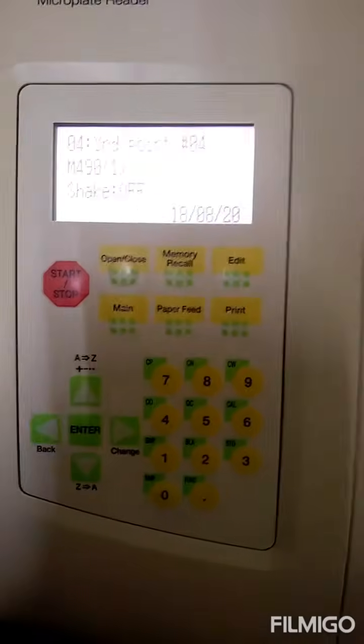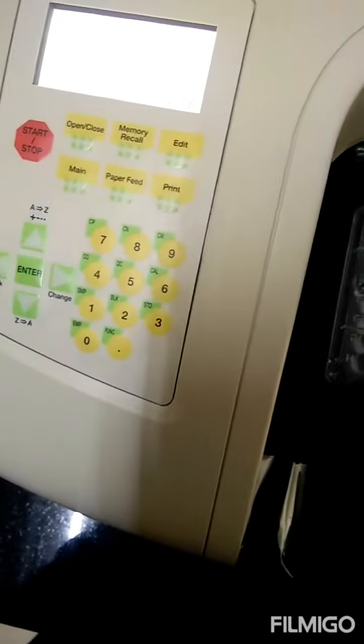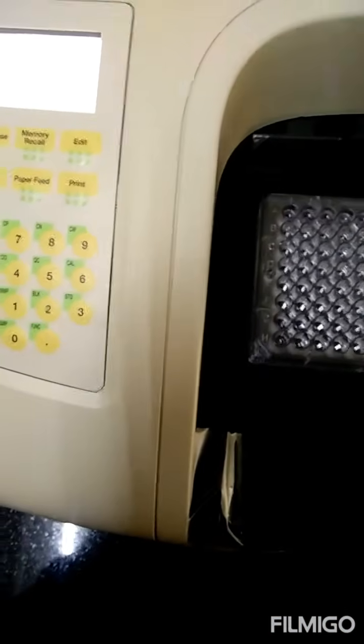Like this I am going to do for all the samples, and I am going to take the absorbance at 520 nanometer, and I will show you that. So friends, now you can see how beautiful pink layers I have got to estimate the proline. I'm going to keep it in this microplate reader, and take the absorbance at 520 nanometer. You can do it with a cuvette also using the spectrophotometric method.